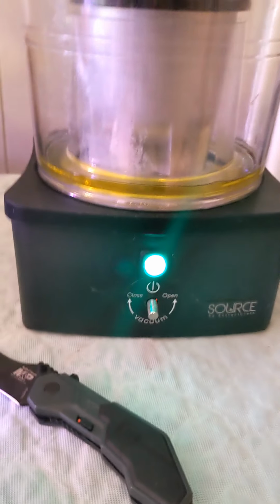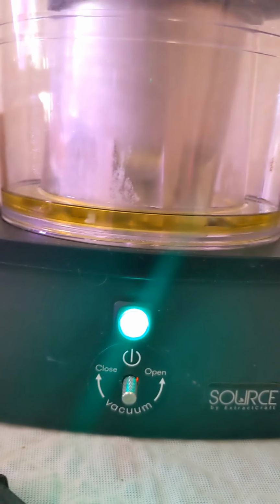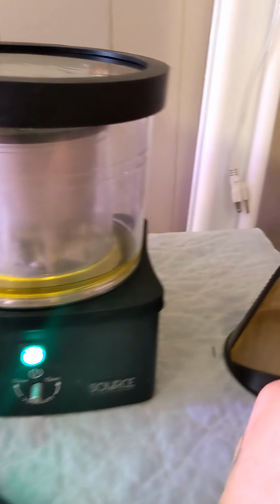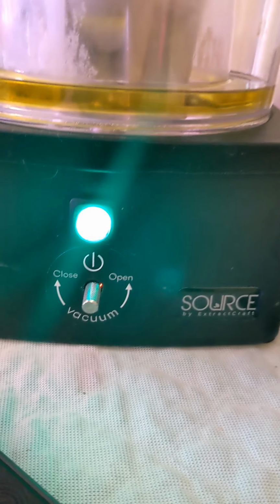A friend lent me this, so I'm not the owner of this yet. I might get it one day. I'm used to using a crock pot, and then obviously you lose all the alcohol. This is pretty sweet. It comes with this mesh filter for filtering, but I actually use a coffee filter anyway. I think a coffee filter is a little better than that. I don't know what micron this screen is, but yeah, this is the Source Turbo.